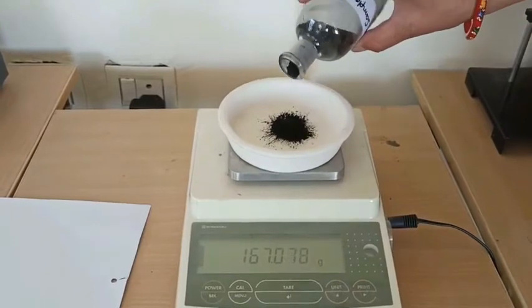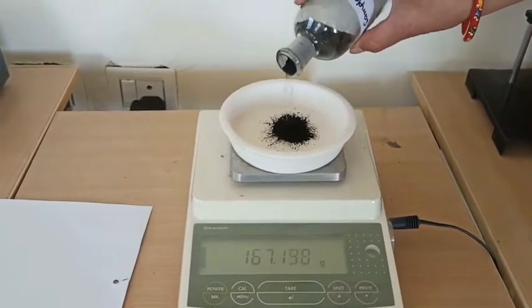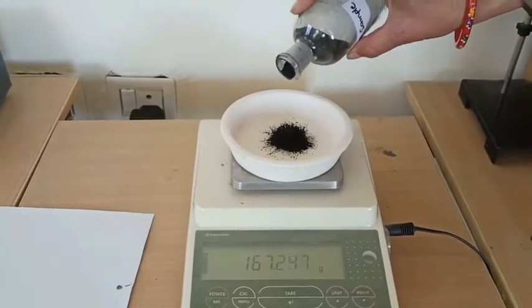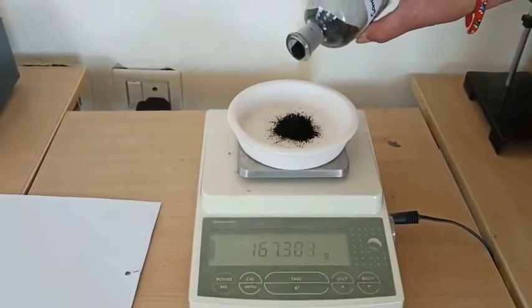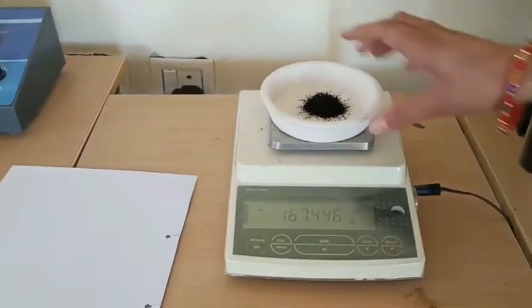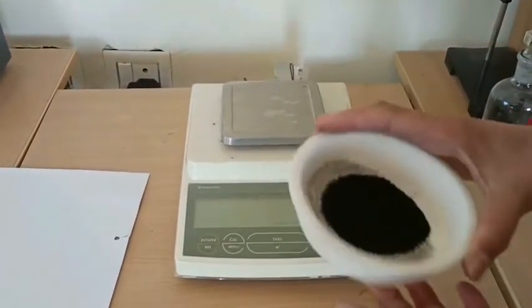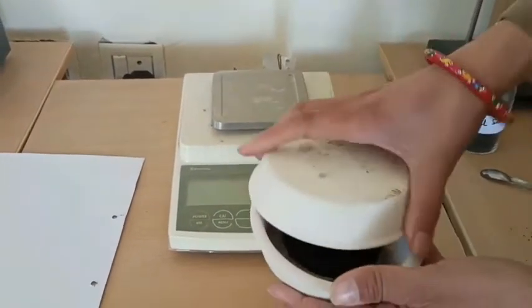Here is the weight of the coal sample — I have kept all these readings in the table. At the end of this video I will show you the detailed description of the experiment. Here is the weight of the crucible with the coal sample — I'll spread this and now I will cover it with the lid.